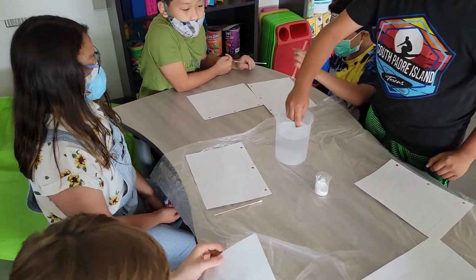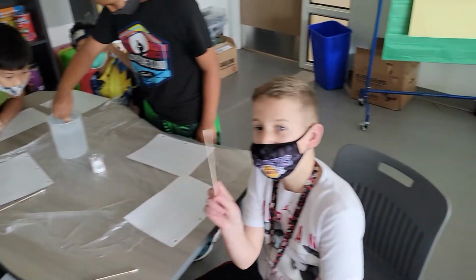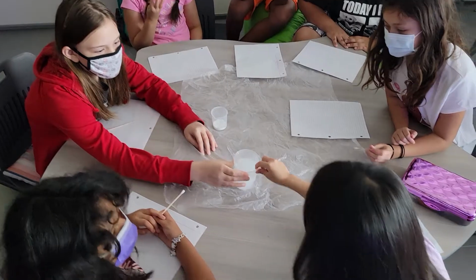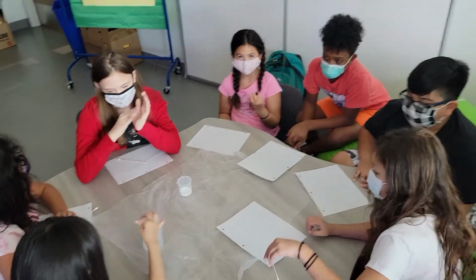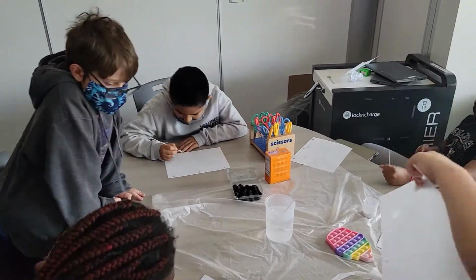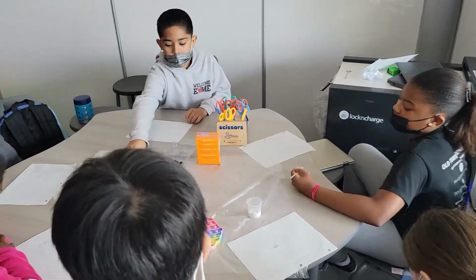So as I walk around and just observe, our friends are continuing what we began at the very beginning. Collaborative effort, teamwork around here. That's how we work in Mr. Champ's class. I am done. Finished? Okay. So make sure you let it dry for 10 minutes. It has to dry for 10 minutes.